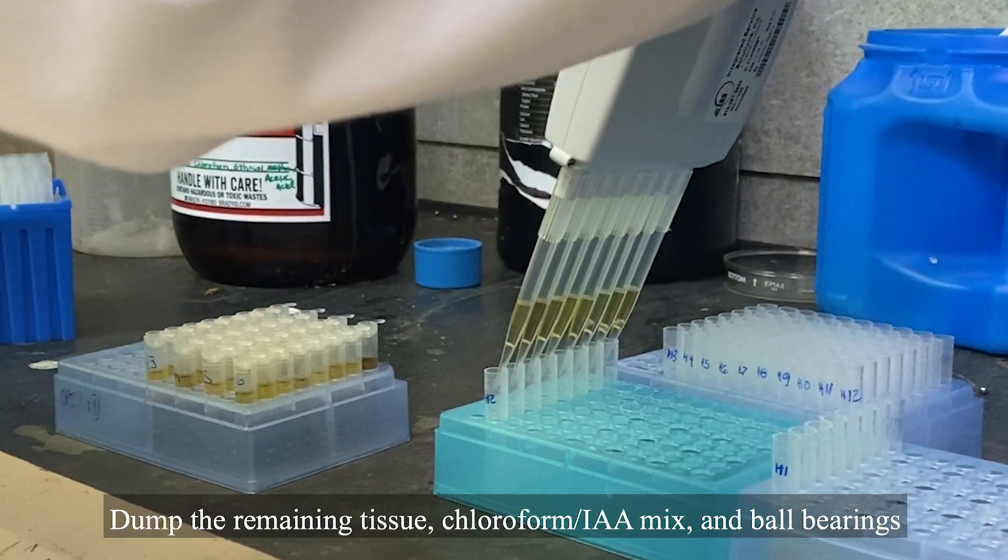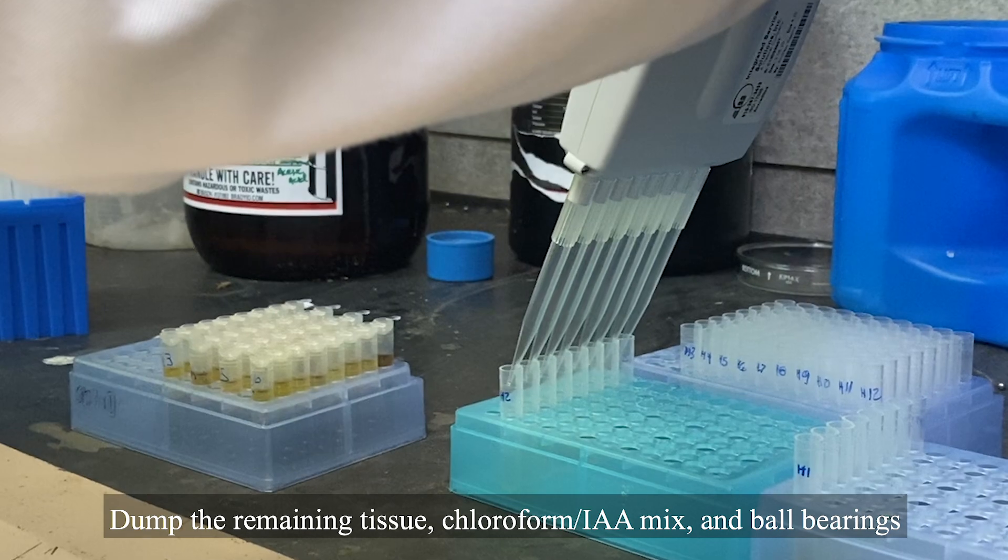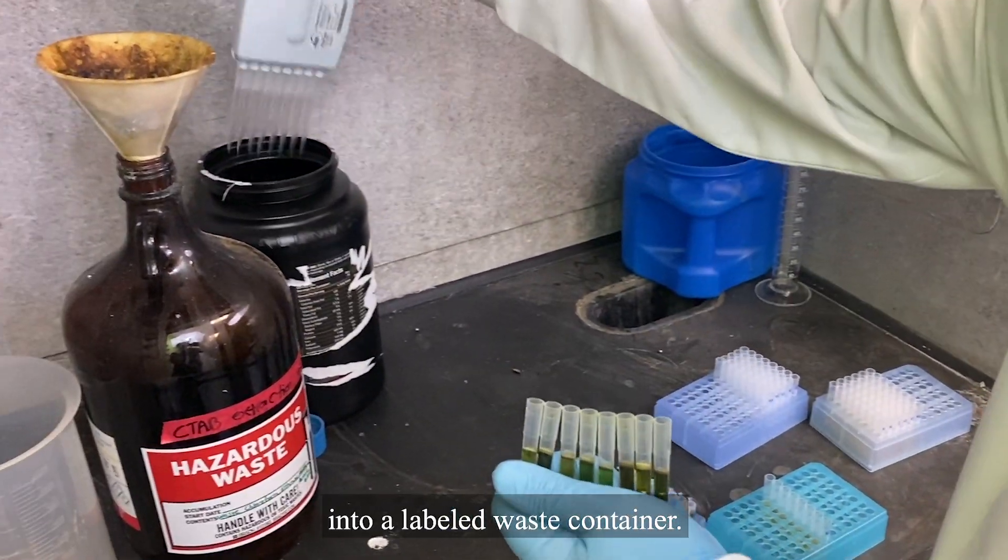Dump the remaining tissue, chloroform isoamyl alcohol mix, and ball bearings into a labeled waste container.